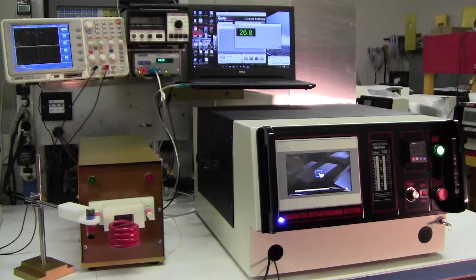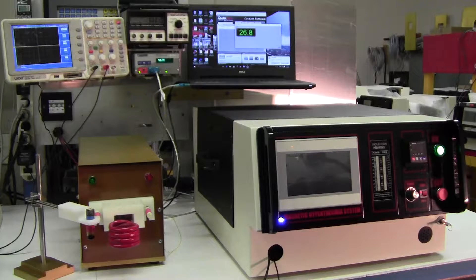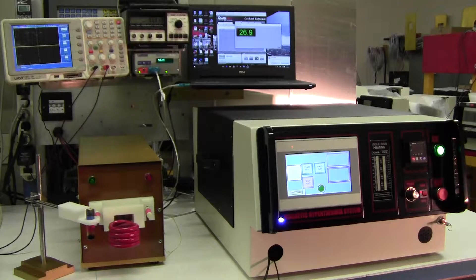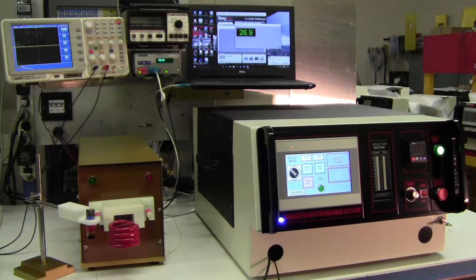After it's turned on, it goes to a startup procedure. The color touchscreen display pops up.